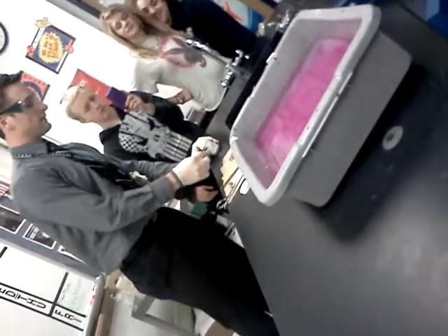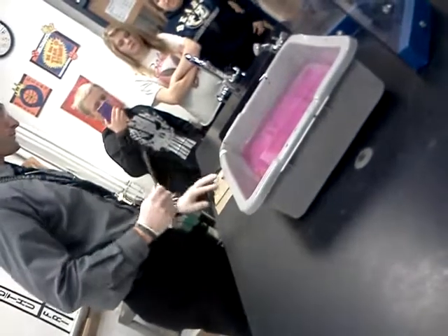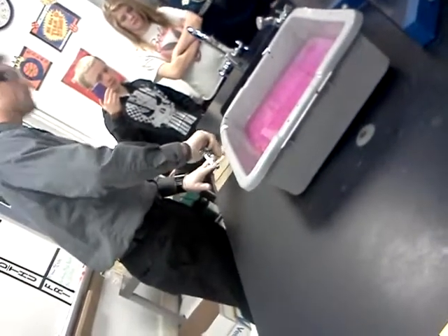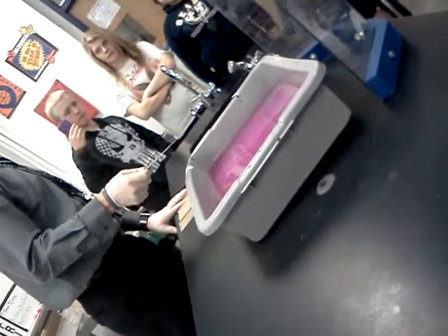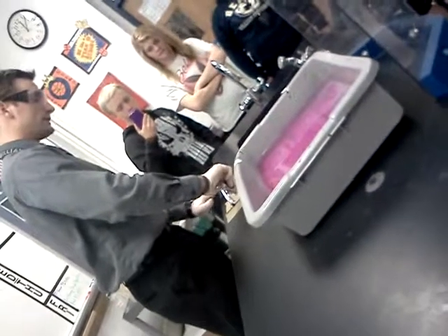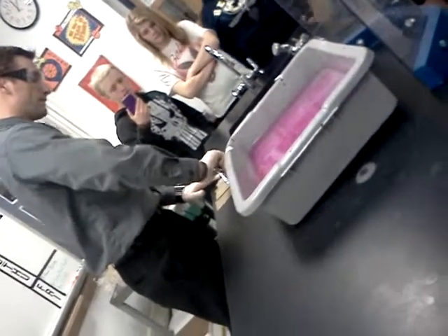Sodium is very similar. Why is it similar to lithium? Paige, why are sodium and lithium similar? I don't know. What do we know about sodium and lithium though? They are both reactive with water. Why is that? Same properties because they're in the same what? Group or family. So this one, sodium, actually is softer than lithium.